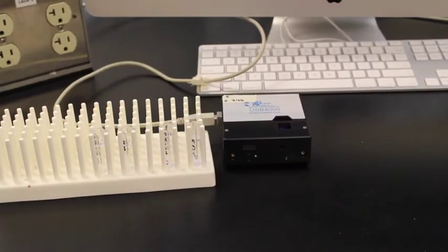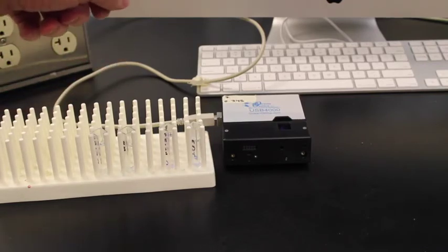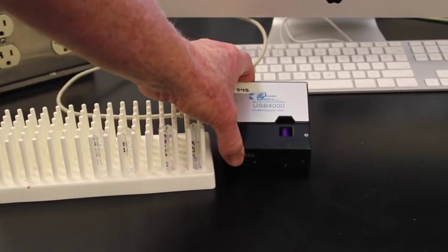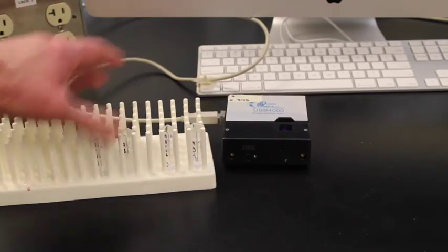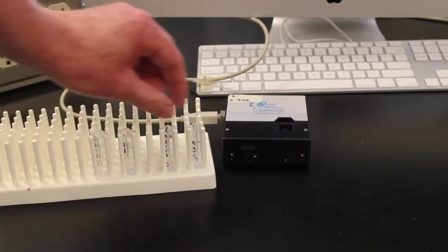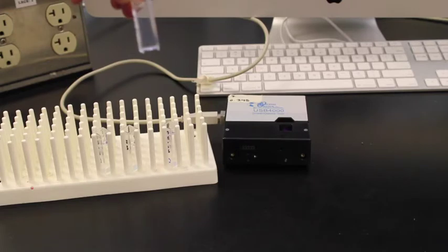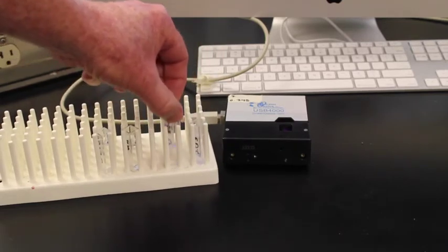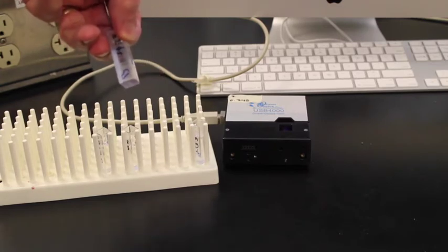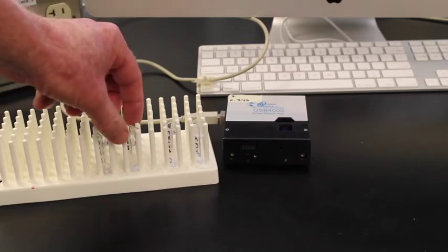Now that we have our solutions in our cuvettes, we can take the cuvettes and use a spec to measure the absorbance. So here's our spectrometer. It's hooked up to the computer with this cord. In front of the spectrometer now we have 4 different solutions. We have the experimental DI solution, which is onion in DI water that we just made up. We have the experimental ethanol solution, which is onions in the ethanol that we just made up.